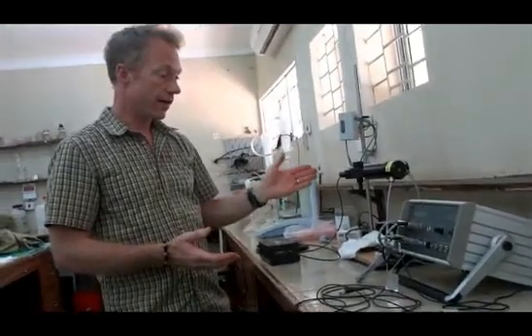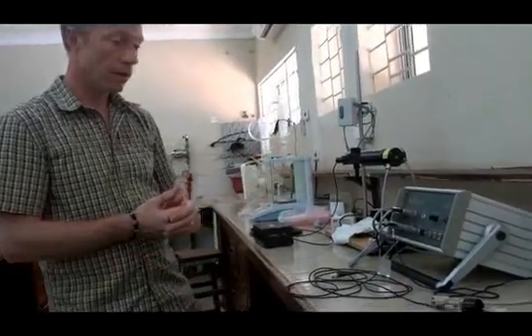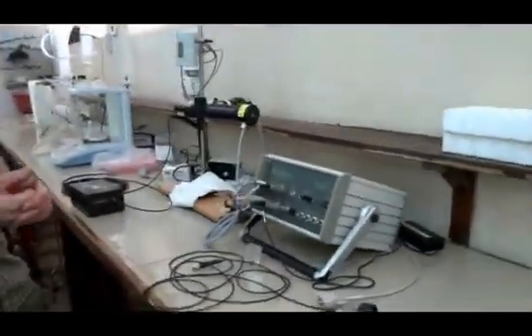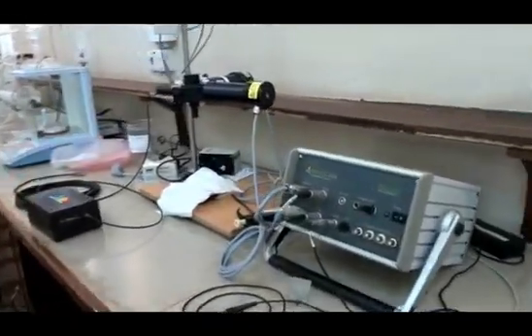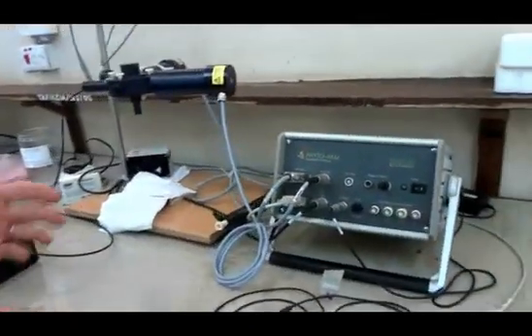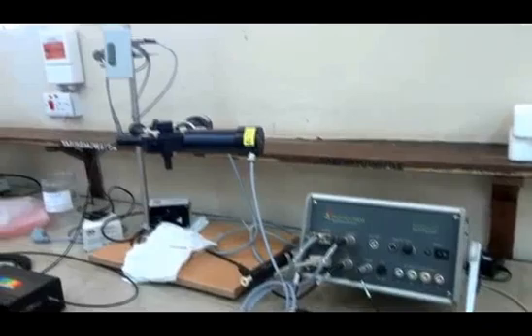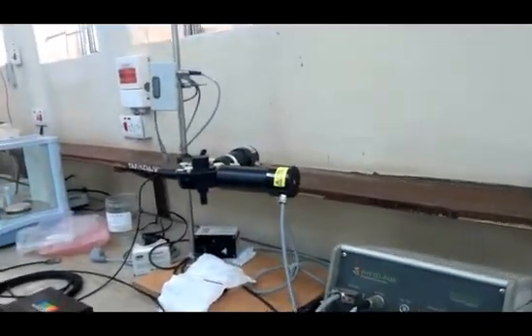The name of this instrument is Phytopam. It's a German product, one of the better ones. It's quite expensive but has proven very valuable for this project.